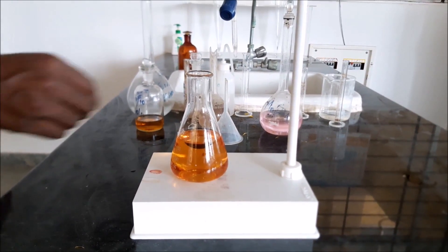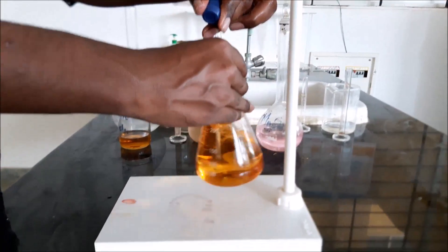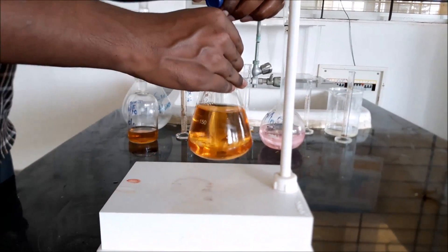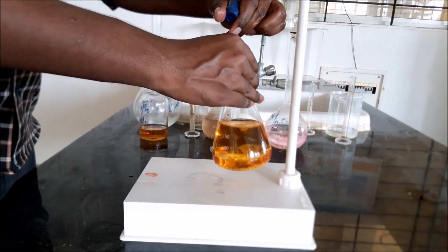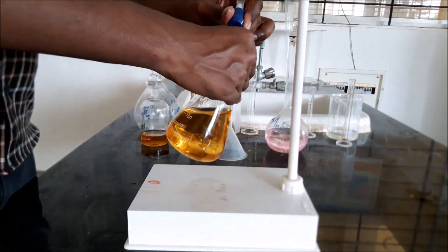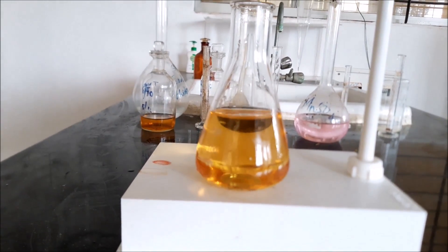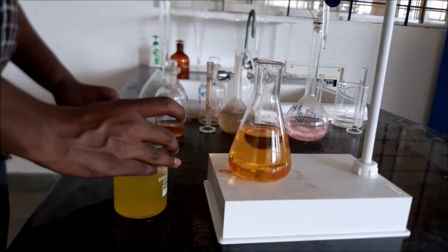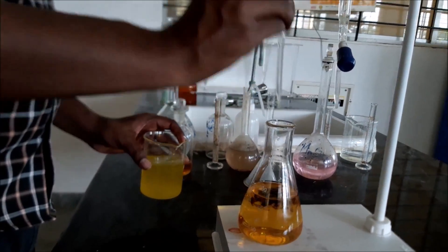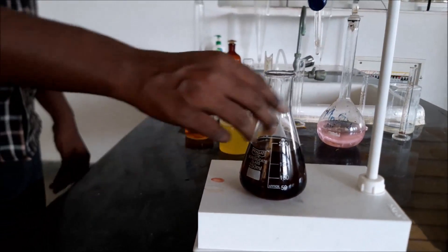Now the solution will be titrated against a standard sodium thiosulfate solution until it turns to pale straw colour. As you can see, from the dark straw colour it has turned to pale straw colour. A few drops of starch indicator are added to the titrated solution. After the addition of starch, it has turned to dark blue colour. Now titrate it until it appears to be colourless.